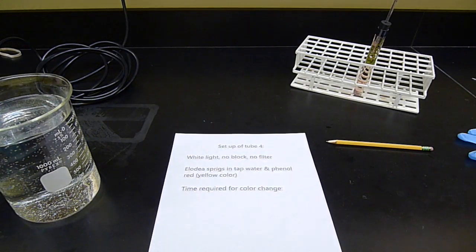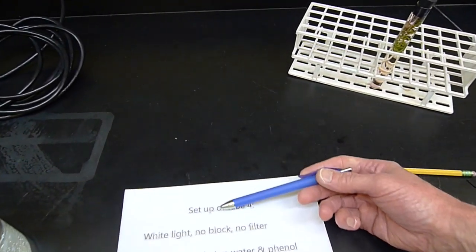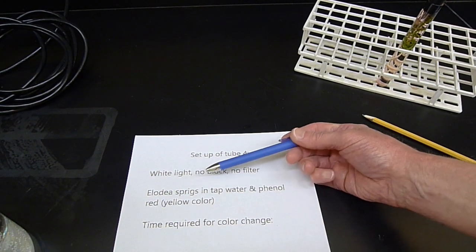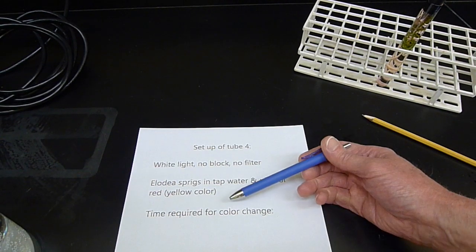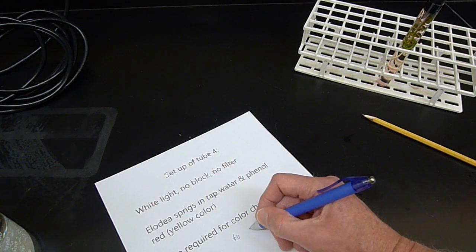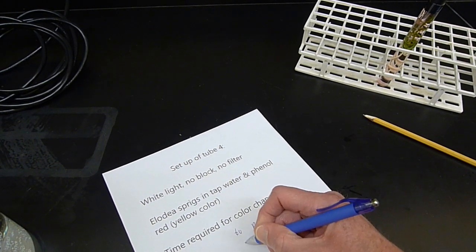So here is the setup that we used for this one. White light, no block, no filter. Elodea sprigs this time in tap water and phenol red. That's what's giving it the yellowish color. And again, for the time for the color change, it's going to change to pink near the Elodea.